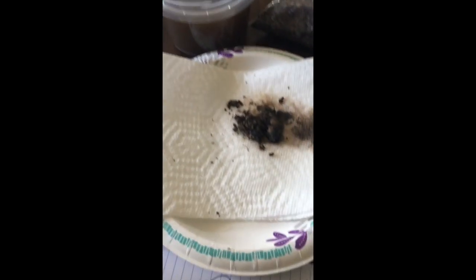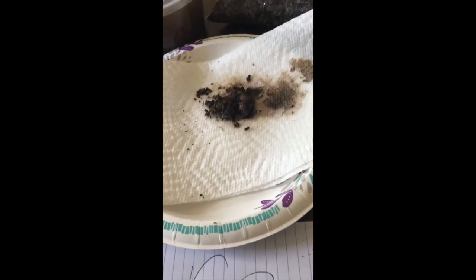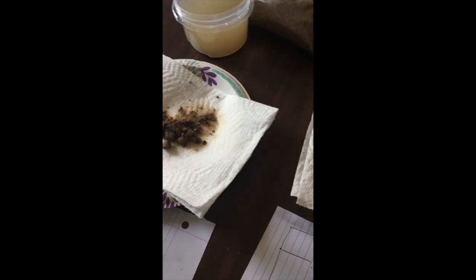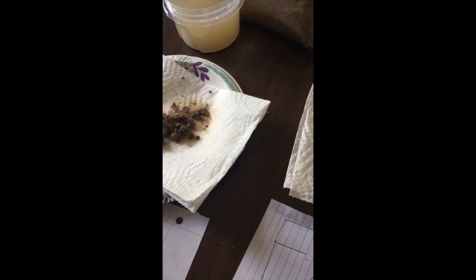While we're waiting for both of these samples to settle for the 10 to 15 minutes that we are advised to, we're going to observe the quantity and shape of the wet soil mass with the presence of soil aggregates. The soil mass should be greater, with less slumping and more visible aggregates, with greater aggregate stability. So let's go ahead and dive into this.